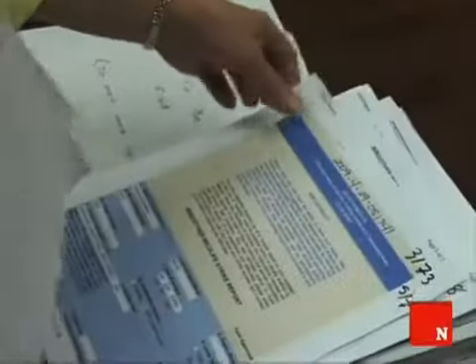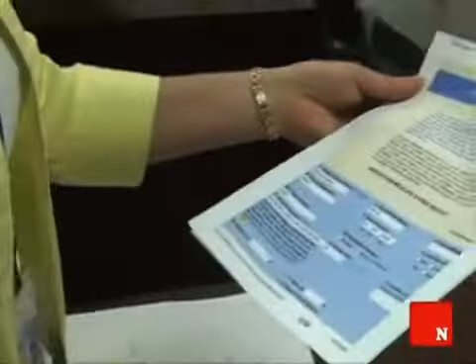Here's an interesting case that came from New Jersey. The date of this bird strike is April 29th. It was an American Airlines, and it has some pretty interesting feathers. We'll take this one out and show you how we go through the process.